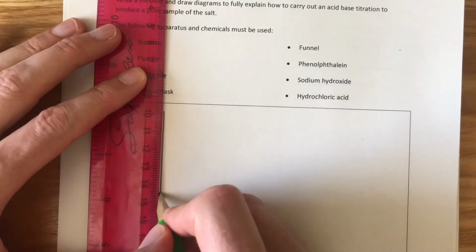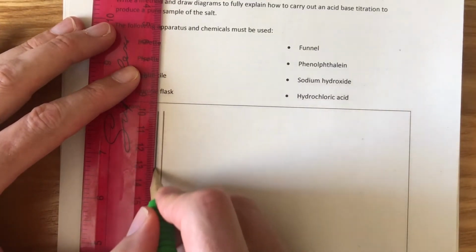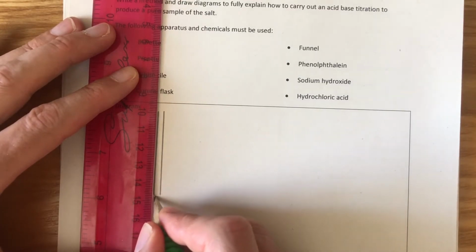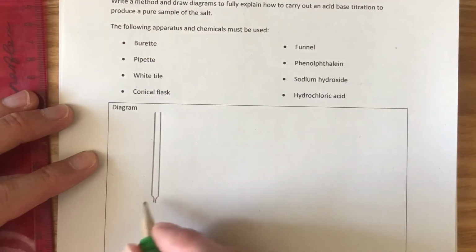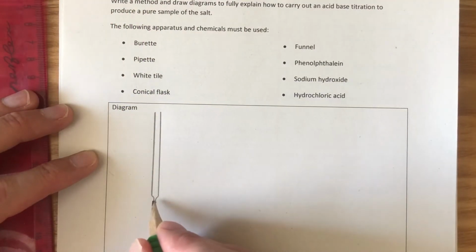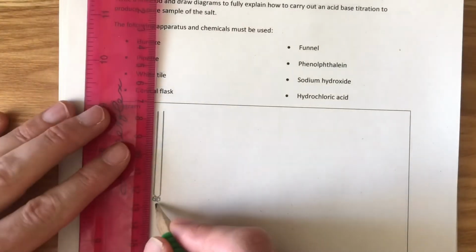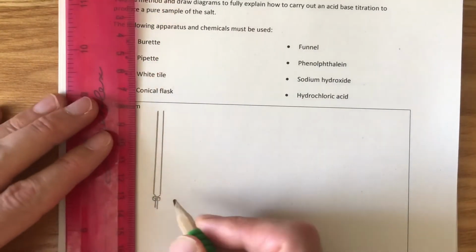A burette is a very long, thin glass tube. Okay, it's very long and very thin because when we add a little bit of liquid to it or run a little bit of liquid out of it, it makes a big difference to the height. So we can see the height change. So basically it allows us to measure out liquids quite precisely. Now it has a tap on the bottom of it, a circle with a cross going through it, and just make the spout come a little bit longer.